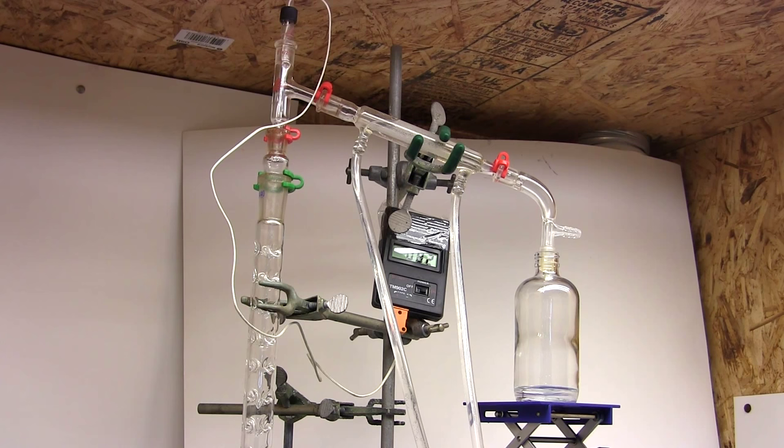Instead I'm going to turn up the heat and just boil out this low boiling component even if I lose a bit of toluene. I can always readjust my column and improve performance later. I just want the toluene and there should still be a lot left over.